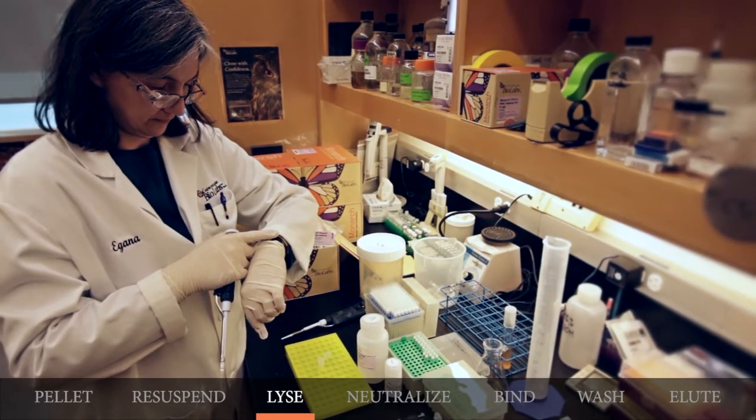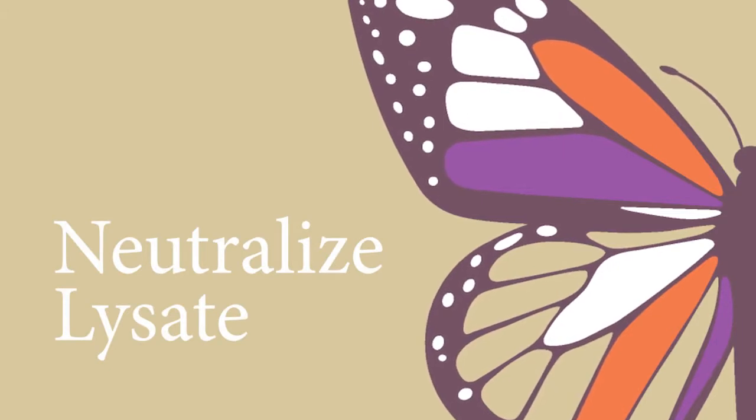Now you will need to incubate for one minute at room temperature to ensure complete lysis. Move quickly to the next step to avoid denaturing the plasmid.